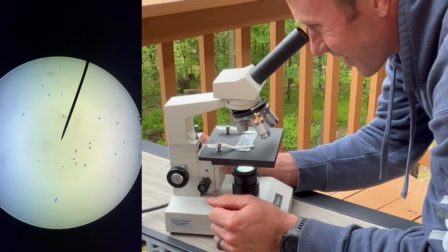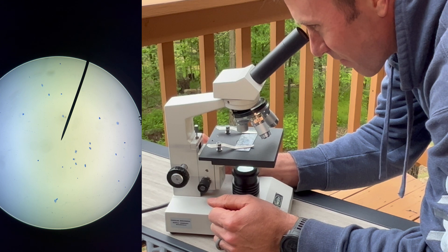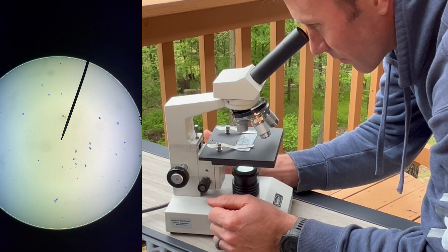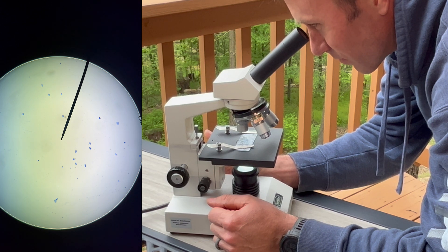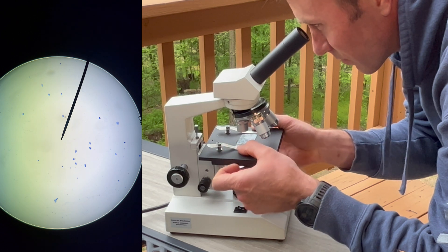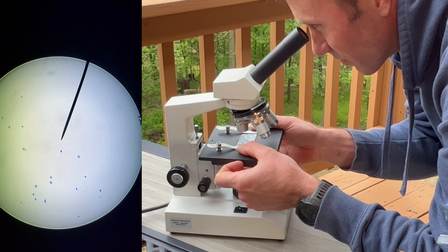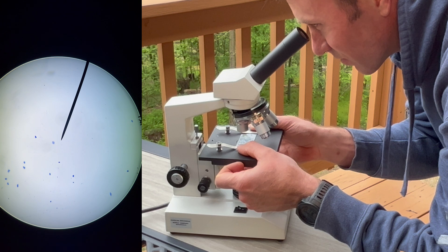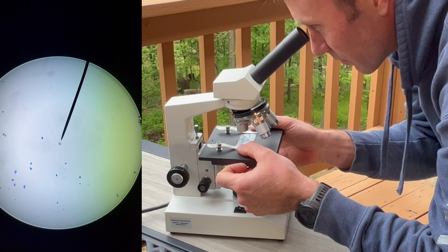Something's coming into focus — and there I have it: a very small image of what I believe to be mouth cells. It's helpful to know what you're looking for. I know that the human cell has a nucleus and is often round in shape. I'm going to take hold of the slide and carefully move it on the stage until I place what I think is the best sample right at the tip of the pointer — because if it's not at the tip of the pointer when I zoom in with the next objective lens, I might lose it.